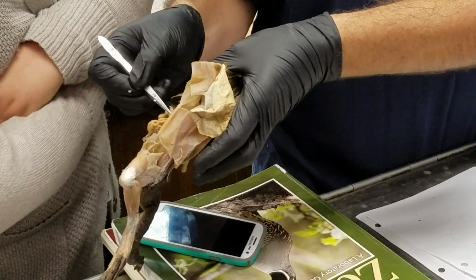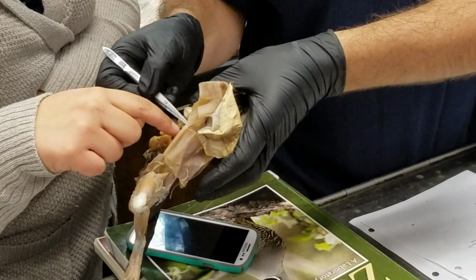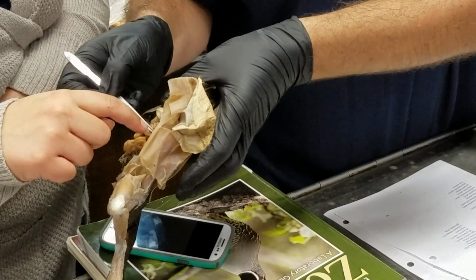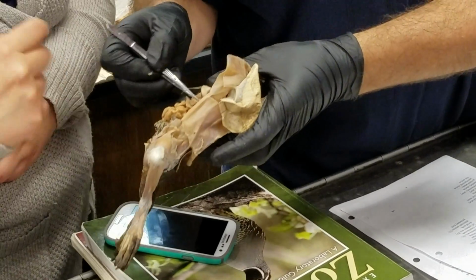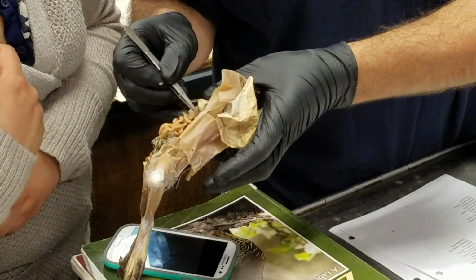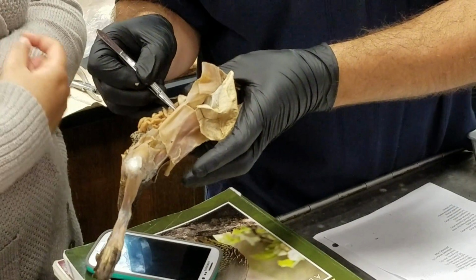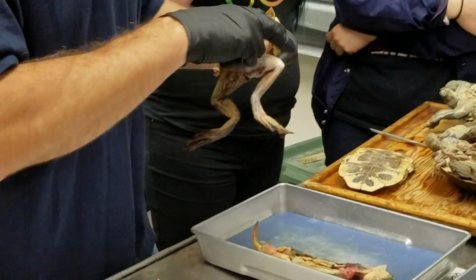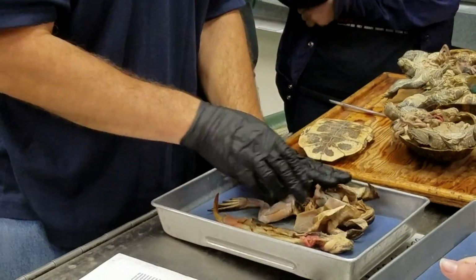This is the left and this is the right systemic arch, and they come together right there to form a dorsal aorta. Is that this like thin piece right here? This is the dorsal aorta here. This is the left systemic. This is the right systemic. Okay. So, yeah, good, okay. All right, so that's the frog.